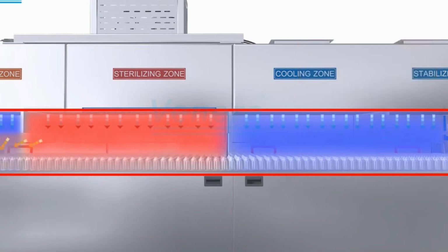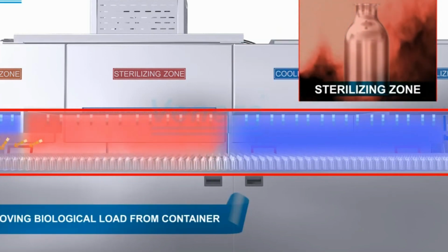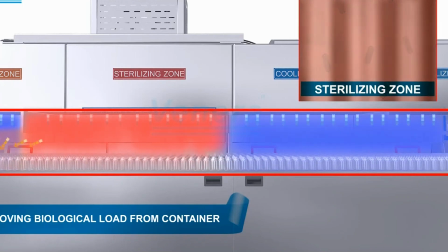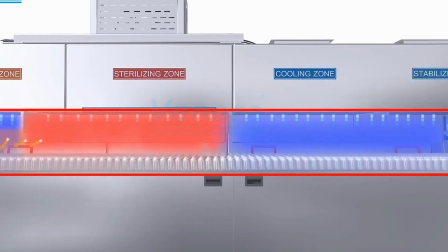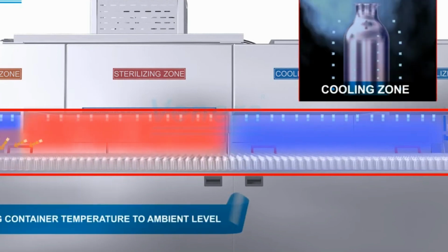Control and monitoring. The entire operation of the depyrogenation tunnel is controlled by a programmable logic controller, PLC, which ensures that all operational parameters such as temperature, conveyor speed, and airflows are within set limits. Continuous temperature monitoring with sensors, thermocouples, ensures that the process meets the defined specifications. The system must have alarms to notify operators if any deviation from the set parameters occurs.